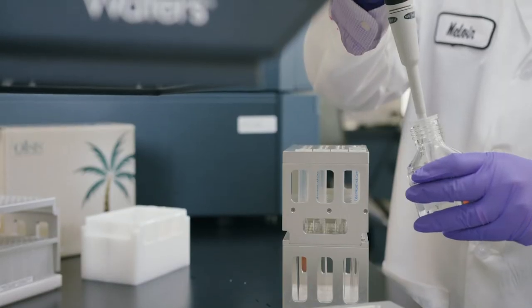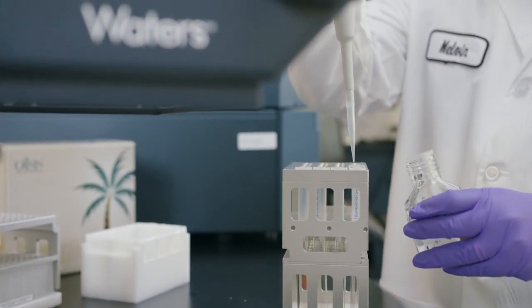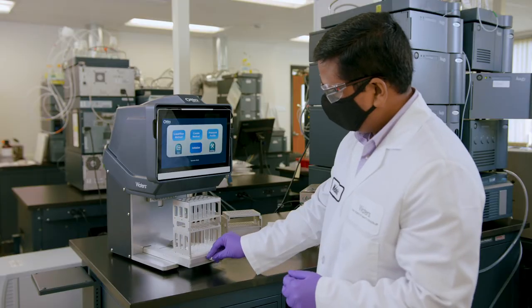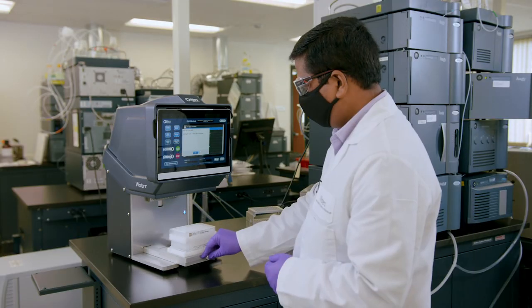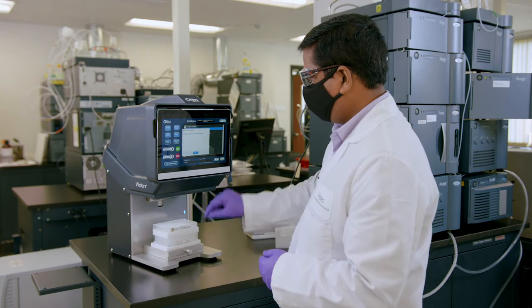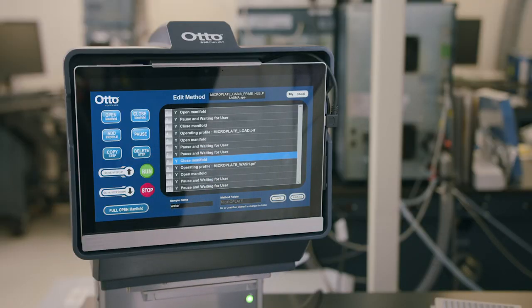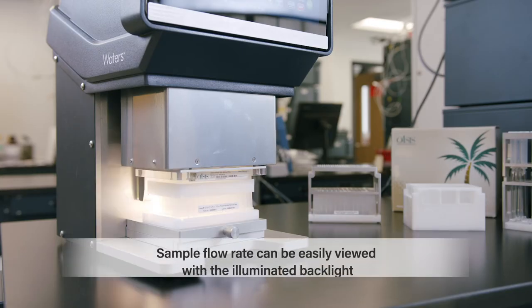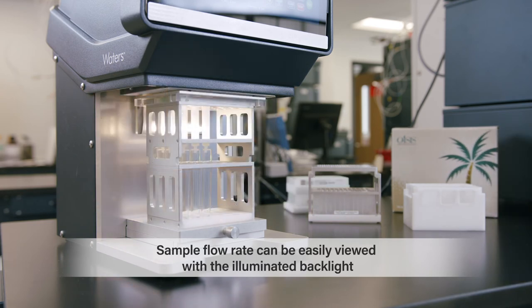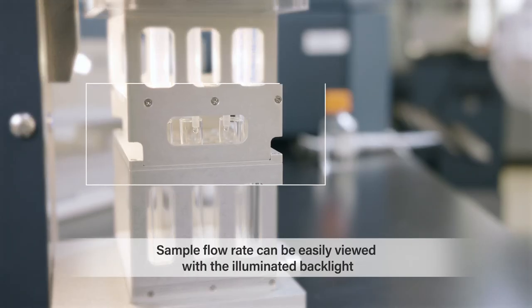Otto Specialist is positive pressure compatible with more than just the standard elution plate. For the first time, use only one manifold for processing both plates and cartridges, making it easy to scale methods up or down. And with the illuminated backlight, the sample flow rate can be easily viewed for each SPE device.